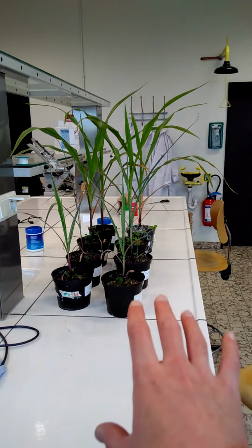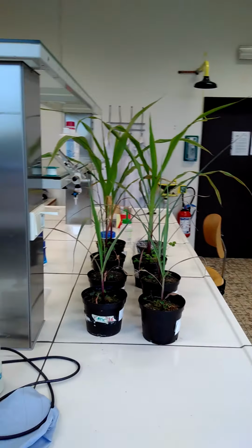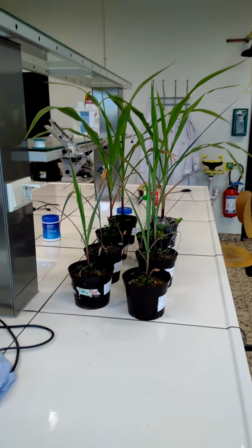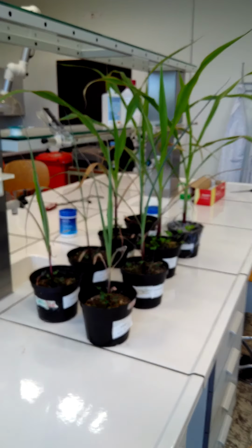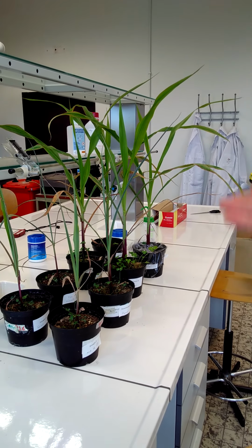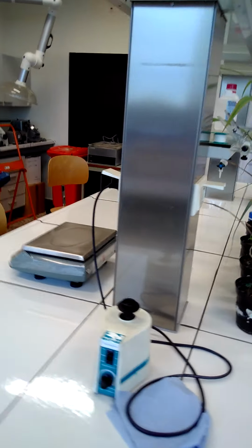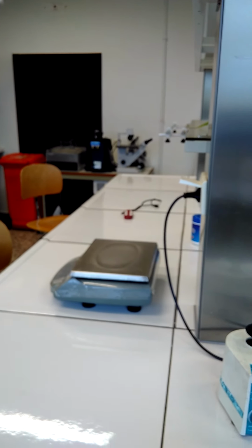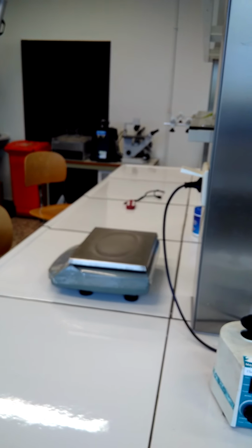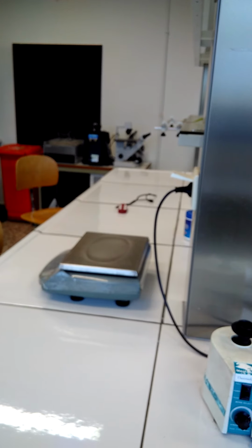So you have these pots over here. And over time, during the practical, which takes a couple of hours, the plants and the pots will lose weight. And that's because water is being lost in the meanwhile. And so you can measure that with a scale. So then normally you will find a more or less linear curve, which will over the hours go down. And based on that, you know how much water, how many grams of water, was lost per hour, for example.